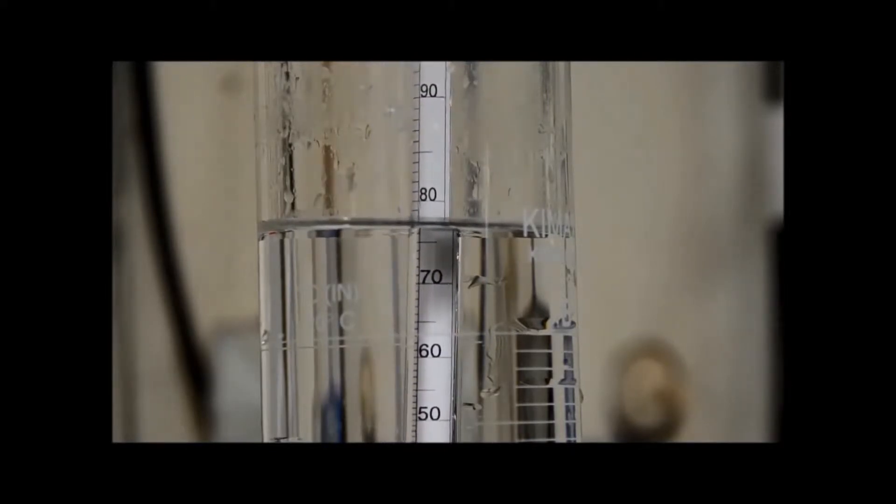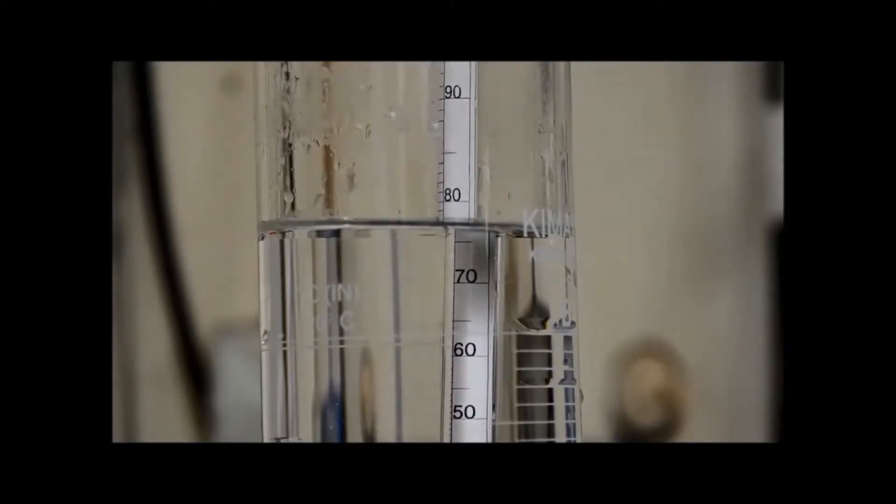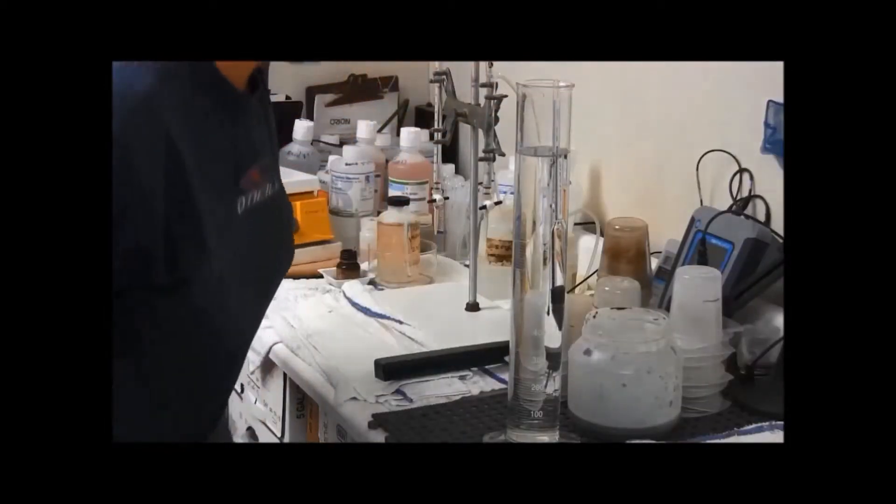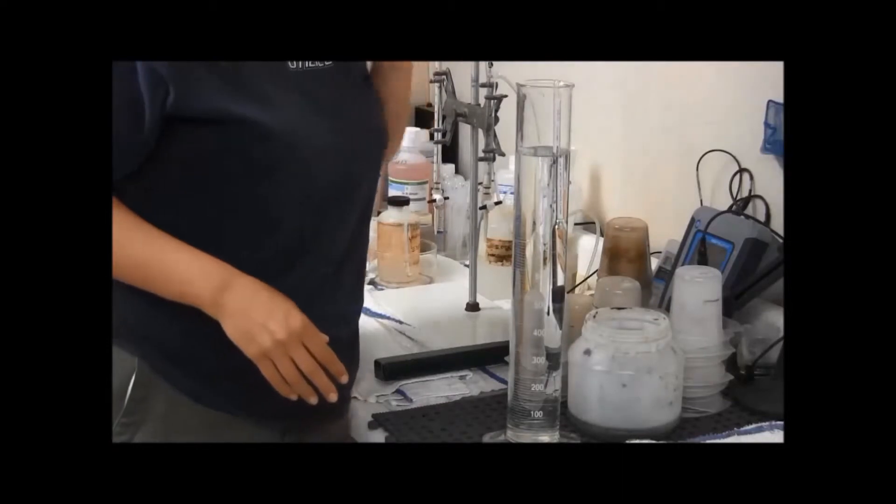And this is looking at right at 76, which should be about right. You kind of want it somewhere between 80 to 75 because it will still dilute a little bit in the sample itself.